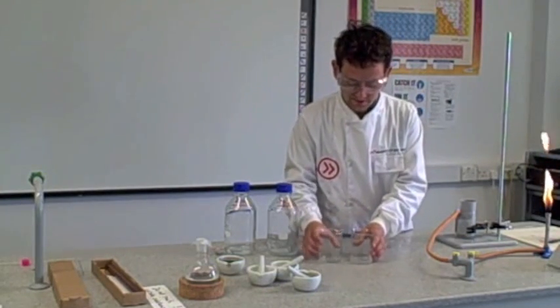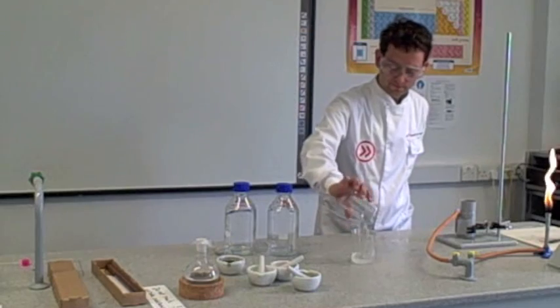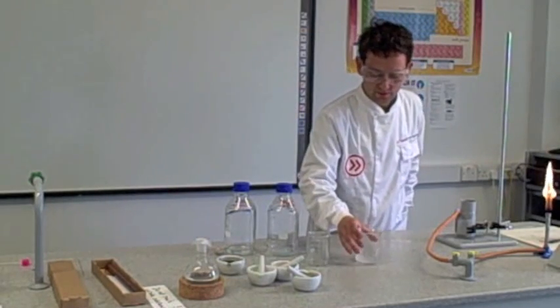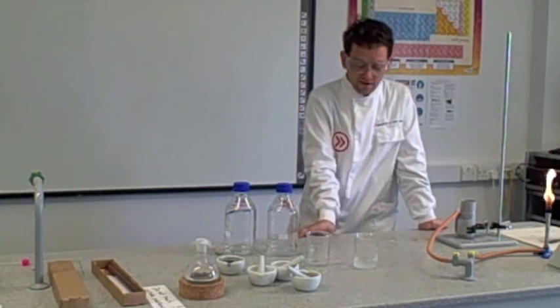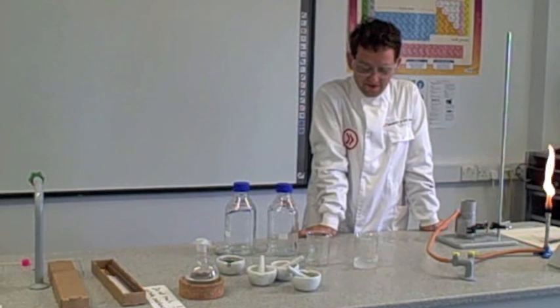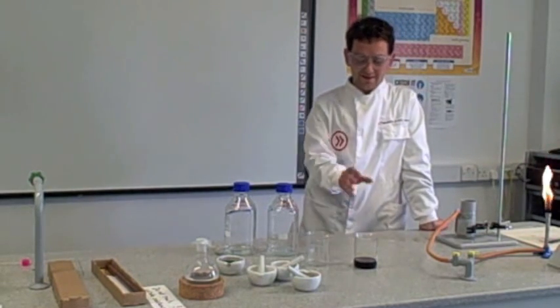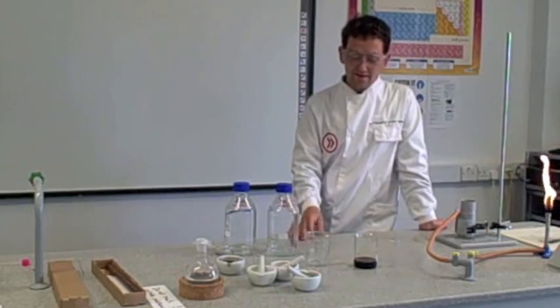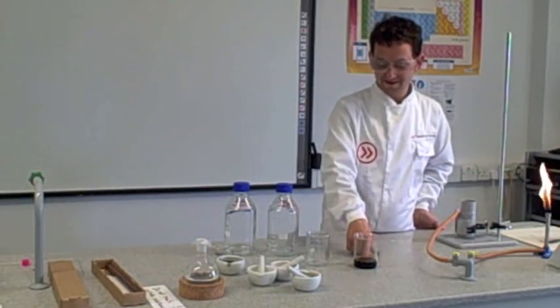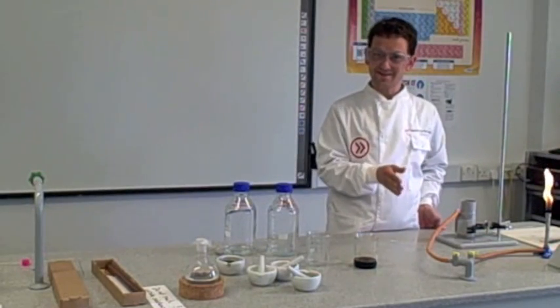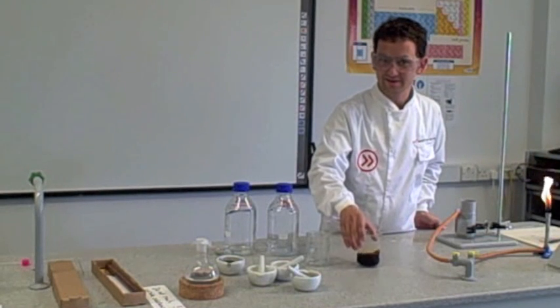So when we mix these, you'll be able to see what happens. Give it a swirl. Three, four, five, six, seven, eight. There you go. Instantly went black. So you can see the reaction was fast and it was delayed, as opposed to just a slow reaction.